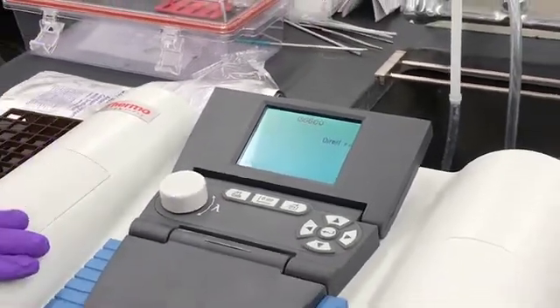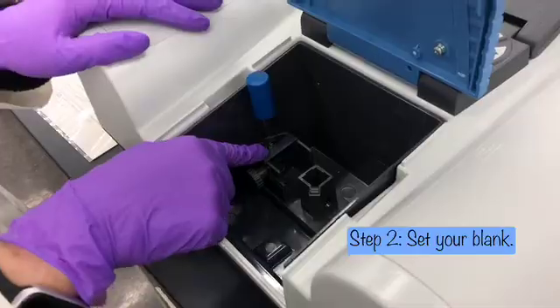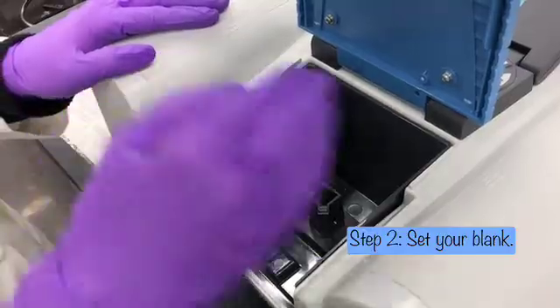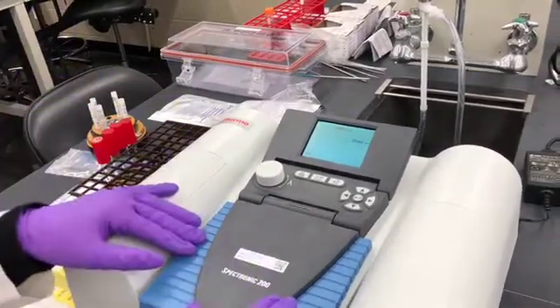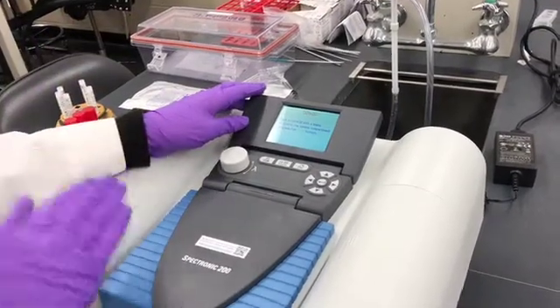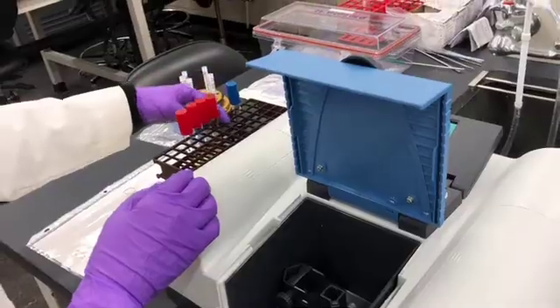The first thing we need to do is tell the machine what zero absorbance is. This machine sends light through our specimen to a detector that senses how much of that light made it all the way through. A clear substance should have a pretty low absorbance reading, but we want to tell it what zero is. We're going to hit enter, place the blank in the round tube position, and press the zero button — zeroing it to give us an absorbance of zero. We're using the blank or un-inoculated sample to zero out our readings.